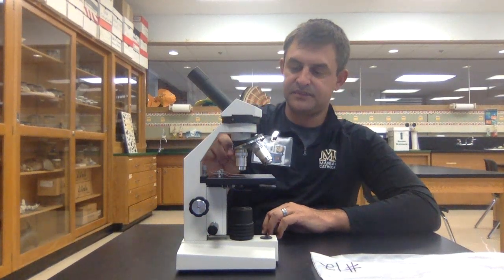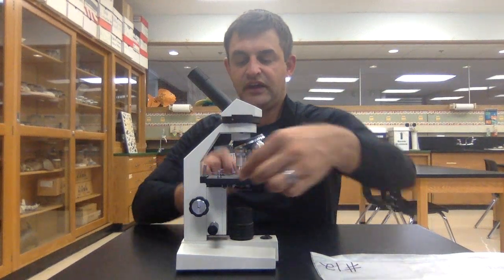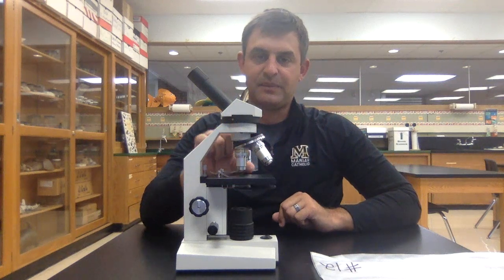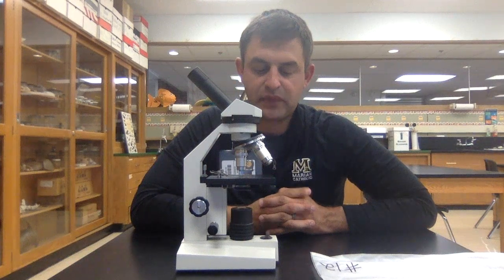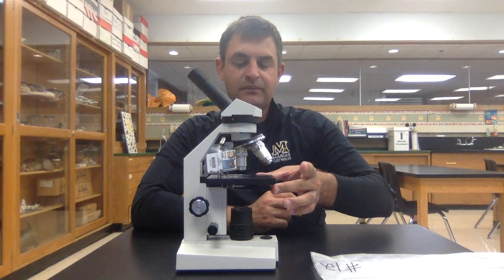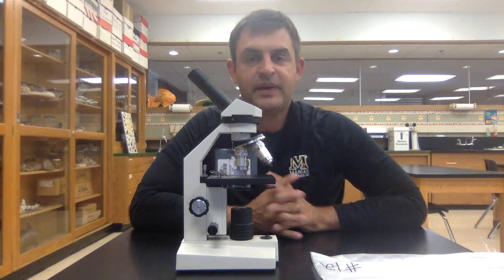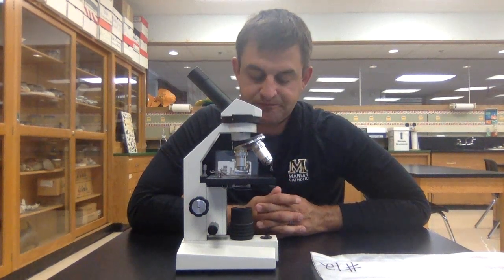Moving down from the lenses, this entire platform is called the stage. These clips on the stage — you can lift them up and put them over the specimen, which just holds the specimen in place so you don't lose it. Beneath the stage, you have a knob that turns called the diaphragm. Its job is to control how much light is hitting the specimen, and that can impact your ability to focus the image.